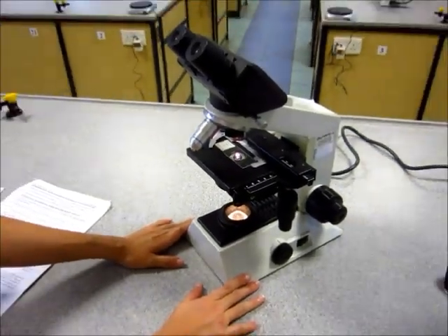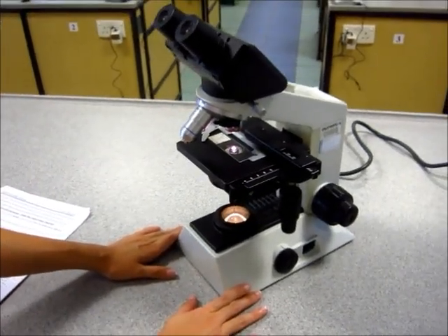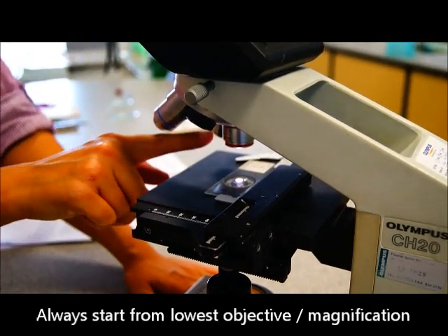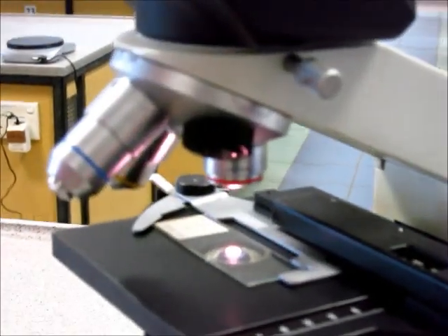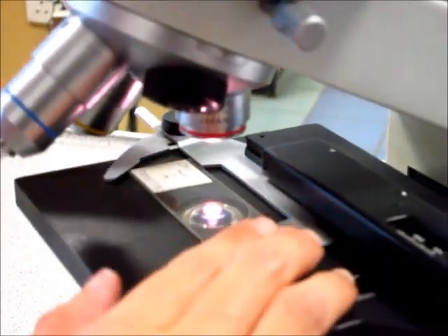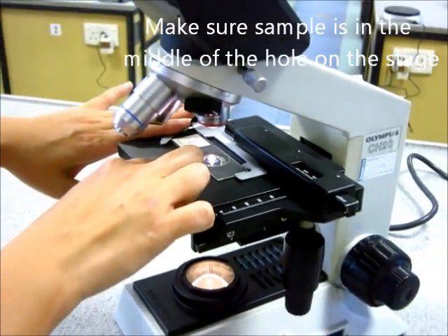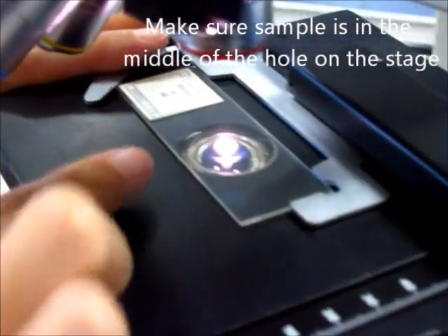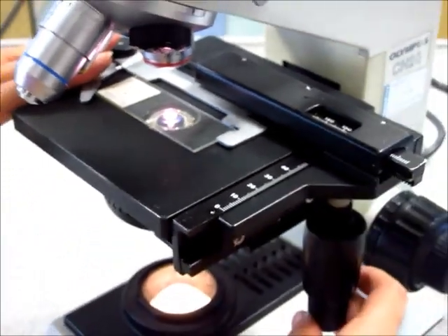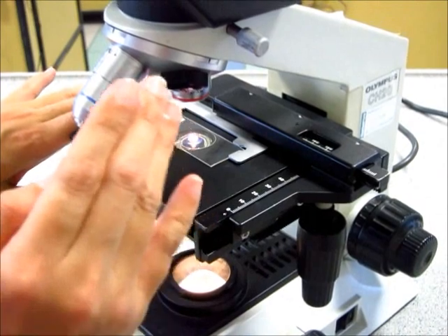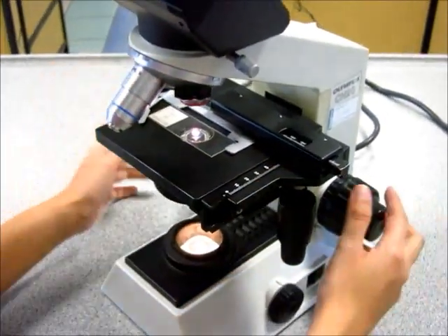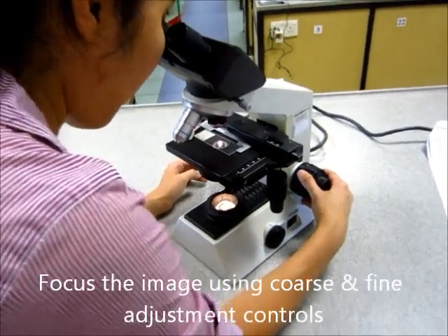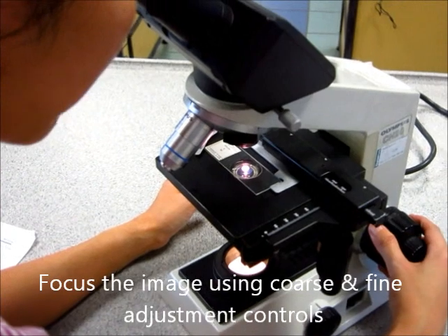Now I'm going to explain to you how to view a sample in the microscope starting from the lowest objective, meaning the lowest magnification to the highest magnification. When we start viewing a sample, we must always start from the lowest magnification. However, before you do anything about focusing the sample, first you need to make sure the sample is in the middle of the stage, right in the center of the hole in the middle of the stage where the light is coming from. So to do that, you use your vertical and horizontal feed knobs so that your sample is in the center where the light is coming from. Then after that, you can move the ocular eyepiece and adjust the coarse adjustment or the fine adjustment knobs so that you can see something.